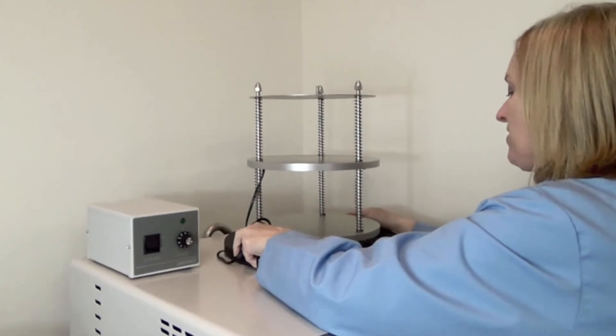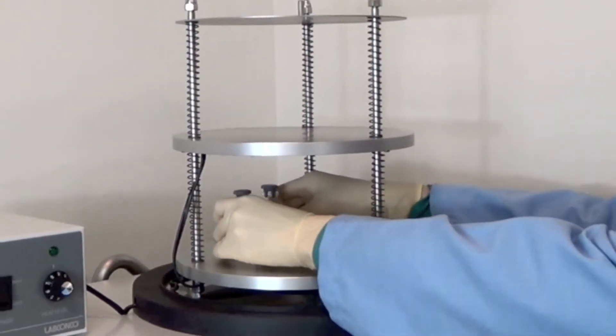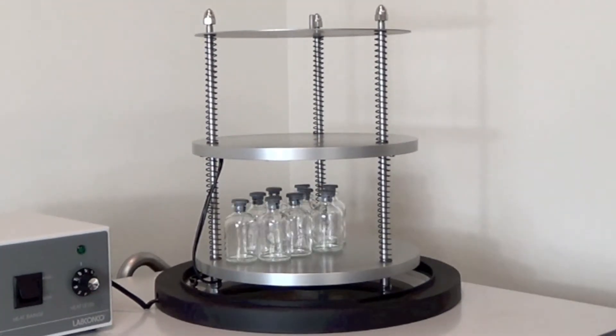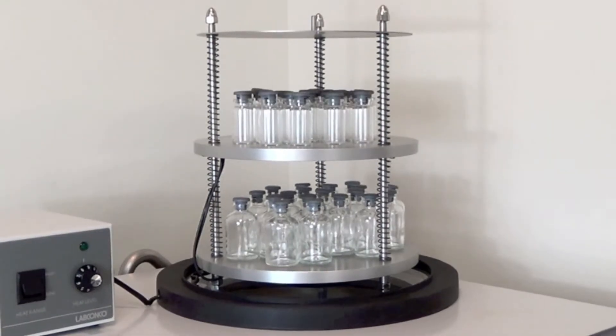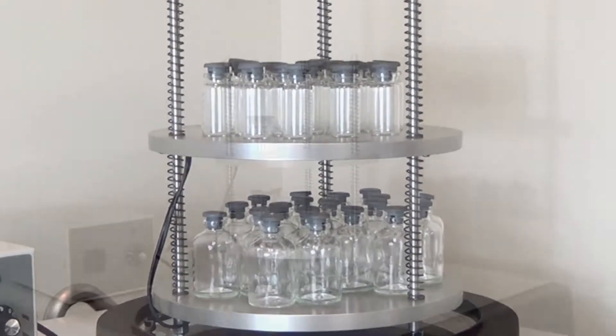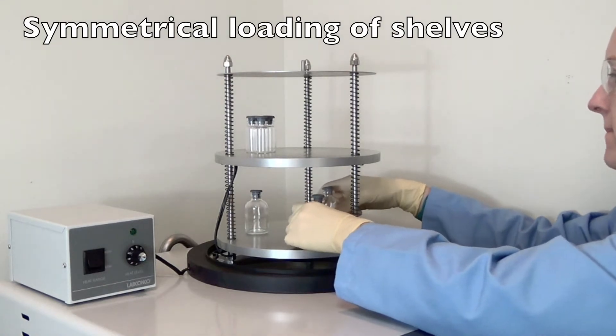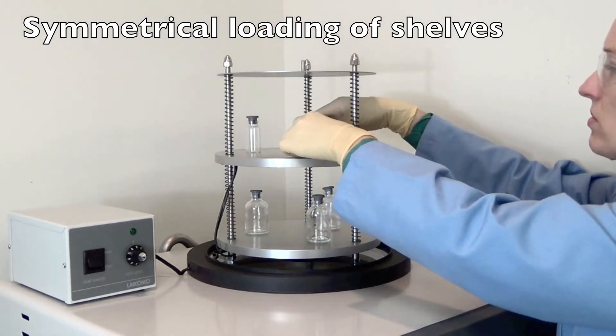When the refrigeration is ready, load the samples onto the chamber's shelves. A minimum of three samples, all of the same height, must be loaded symmetrically onto each shelf.